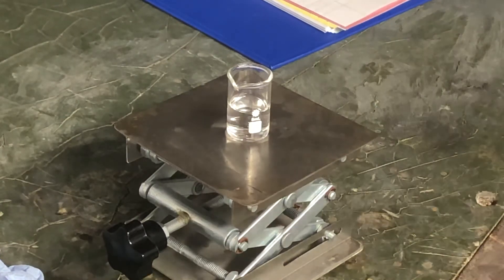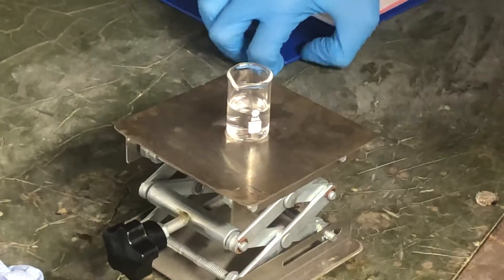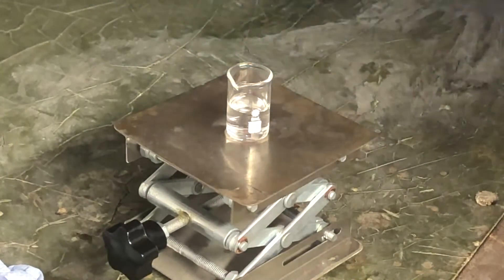Hello, in this small video we're going to be making some iodoacetone, which is quite interesting.